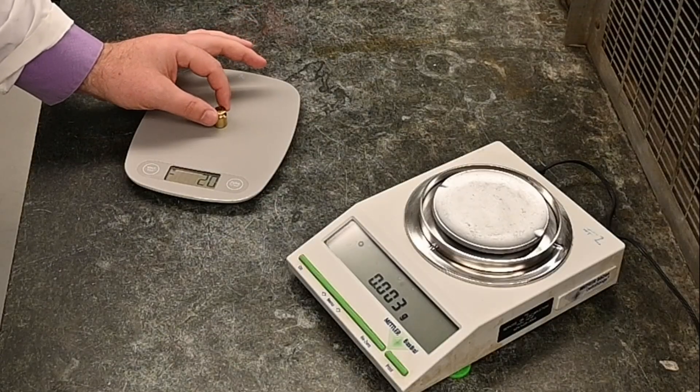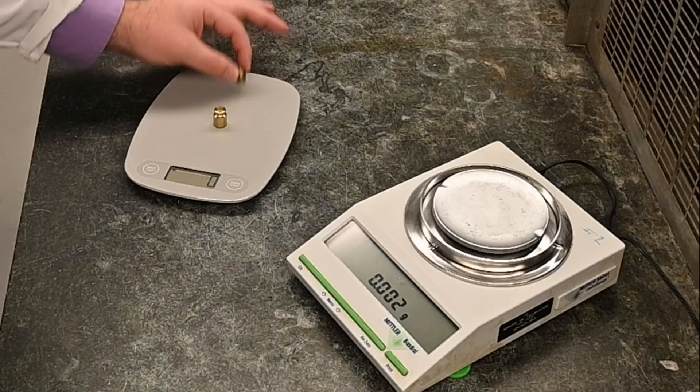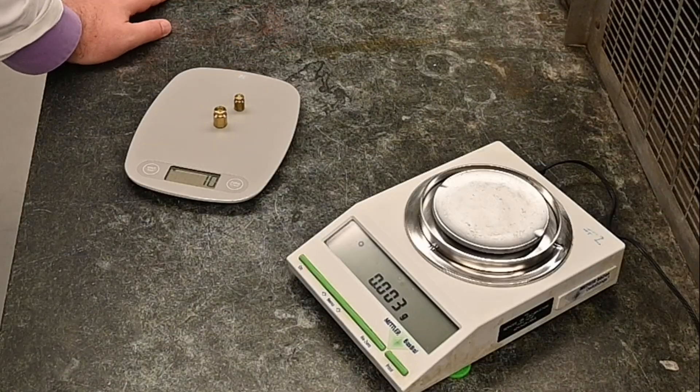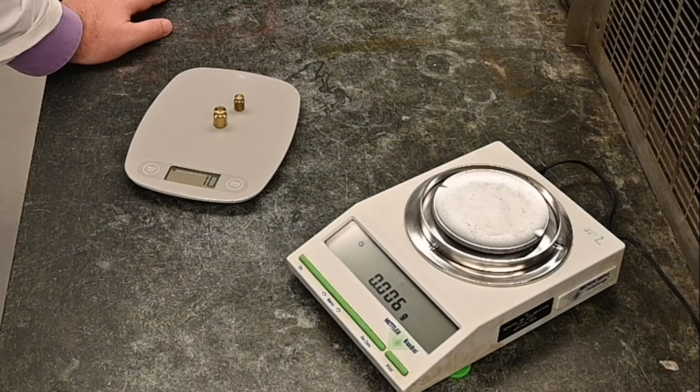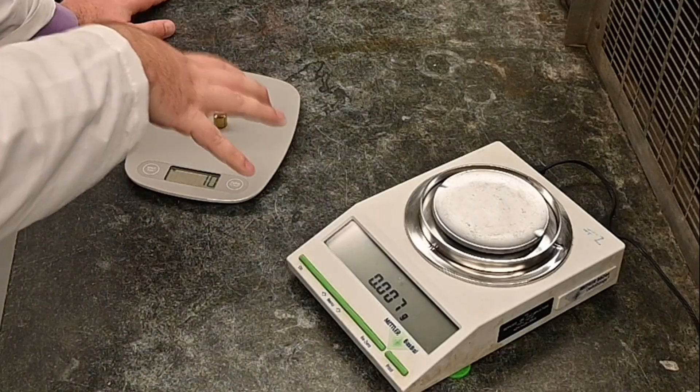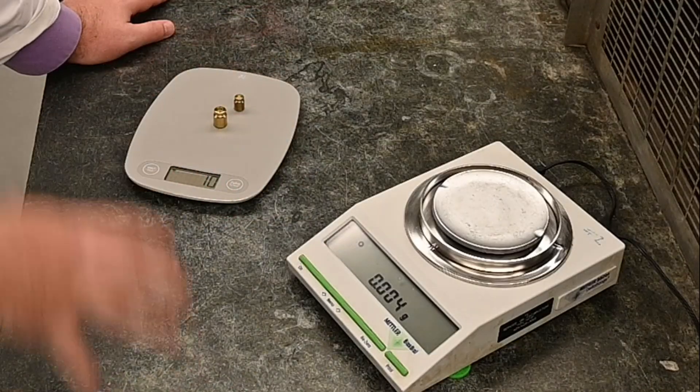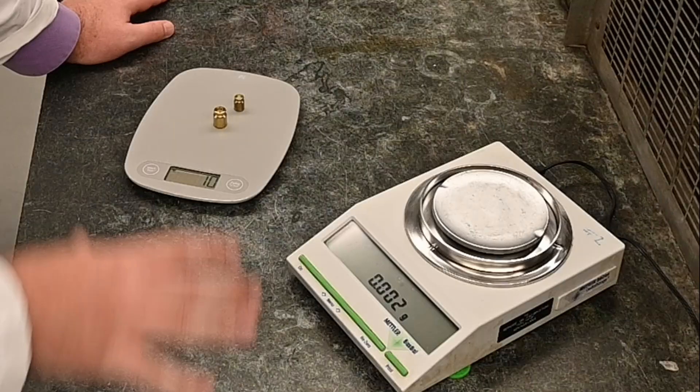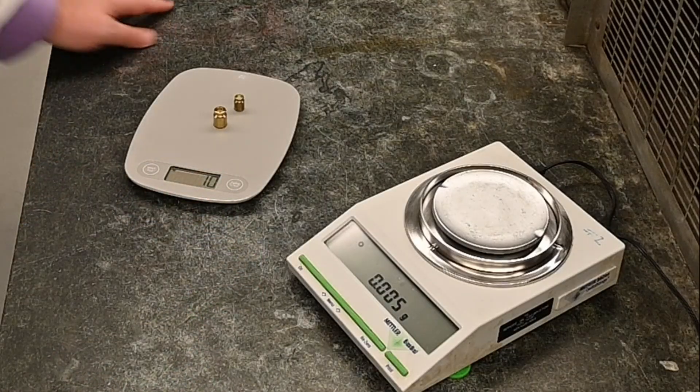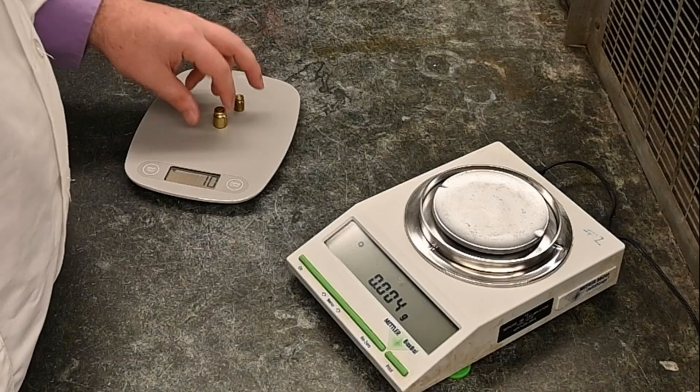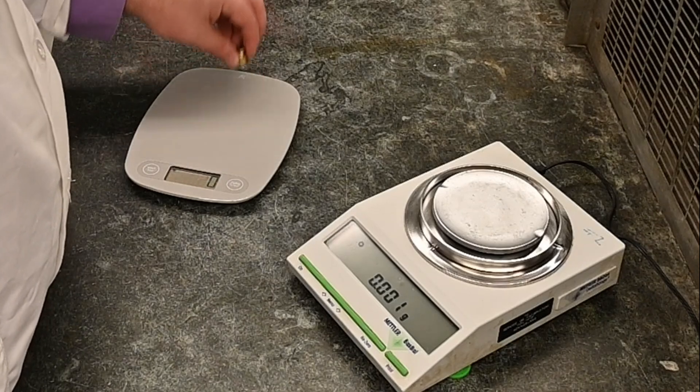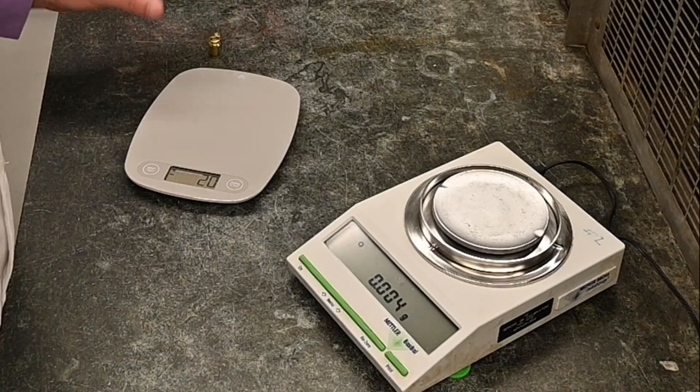Digital balances, usually, they're a little more, I wouldn't say they're more delicate, but you can really mess them up. There's a couple things you do. One thing, don't add too much weight to them, too much mass to them. And usually the range is around 500 grams. But if you're from America, it's roughly a pound of mass, which isn't much. It isn't much.